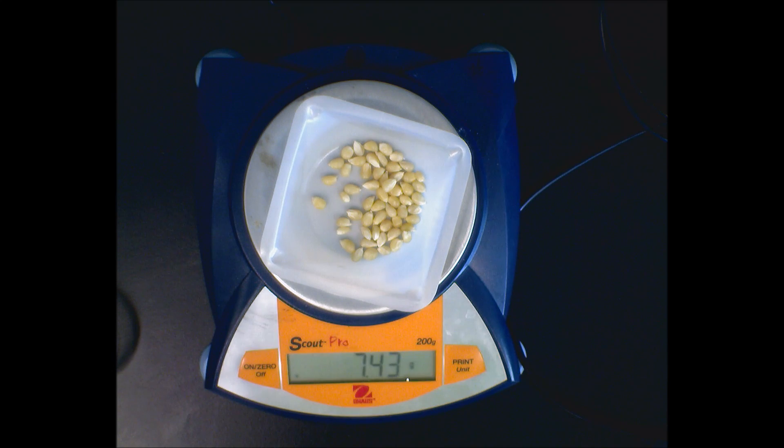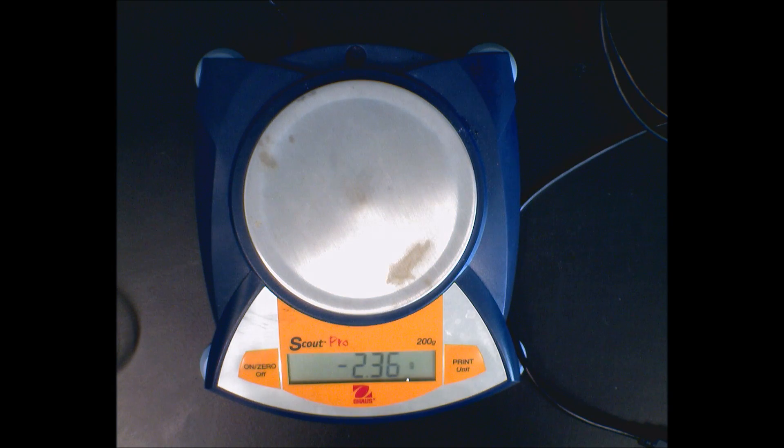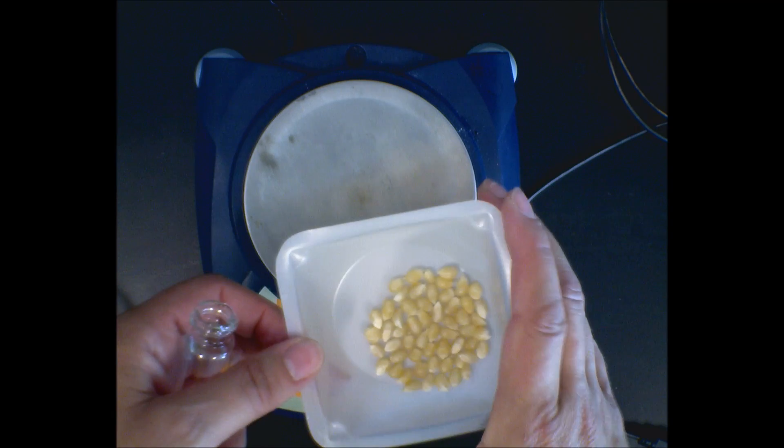So if you're doing single trials, this is very handy. But if you're going to try to be efficient and do multiple trials, you are going to have to know what the mass of this is, because not all weighing boats have exactly the same mass. You cannot assume they all have the same mass. And if I take this off, that's the mass of the weighing boat originally.